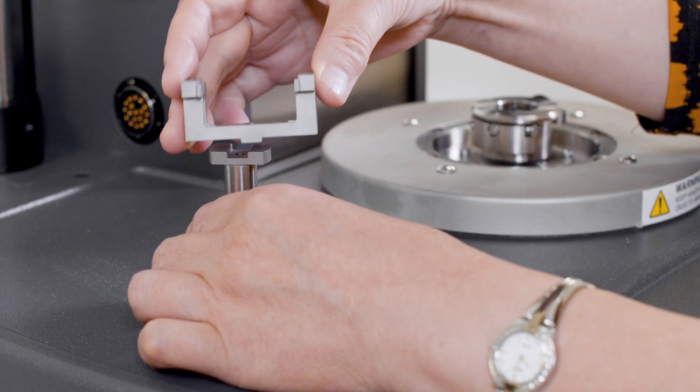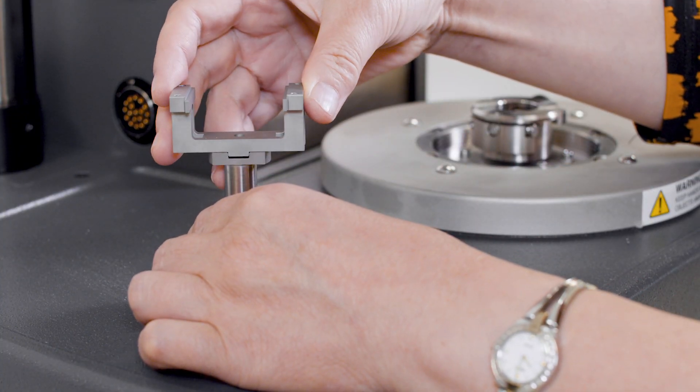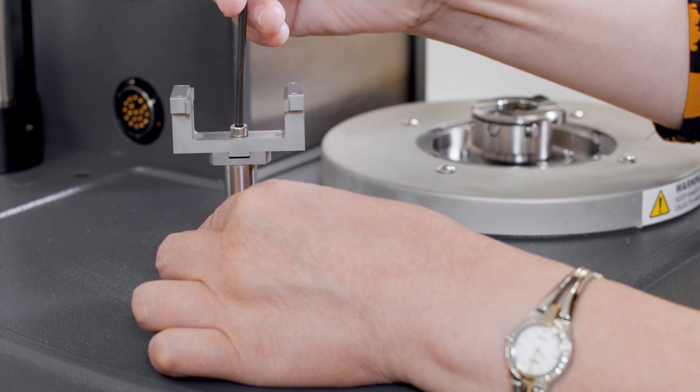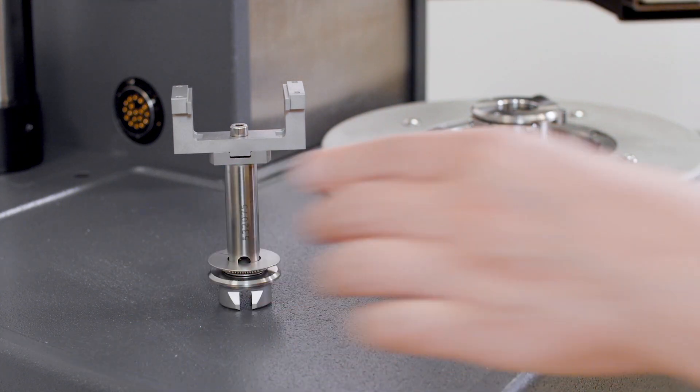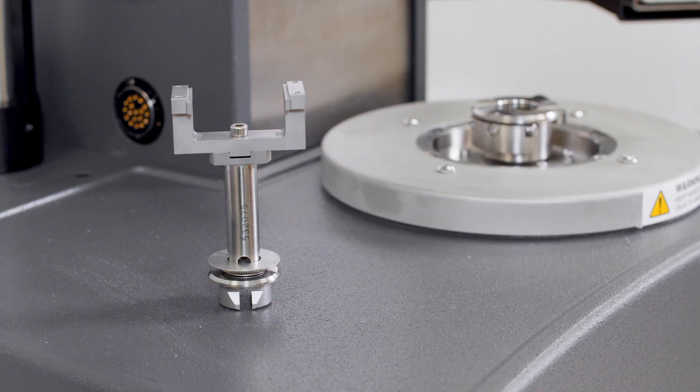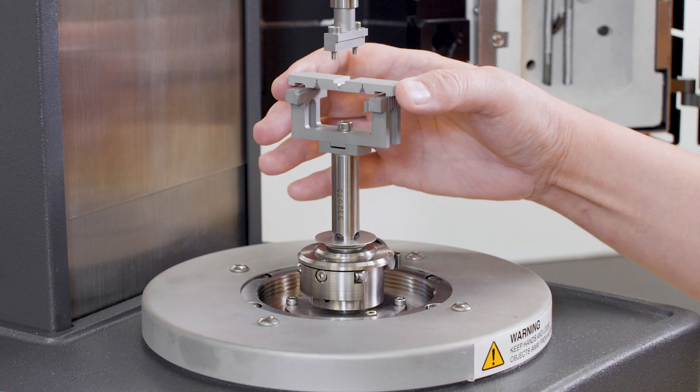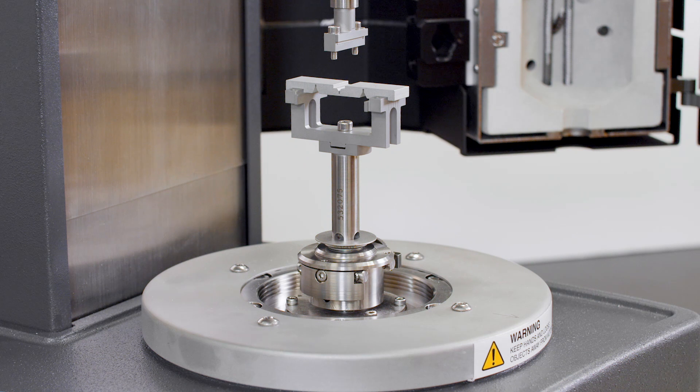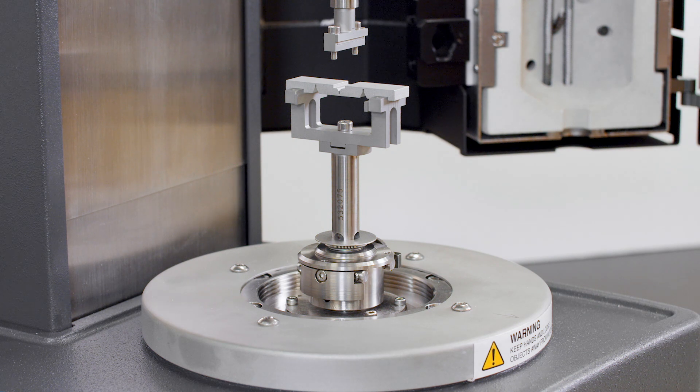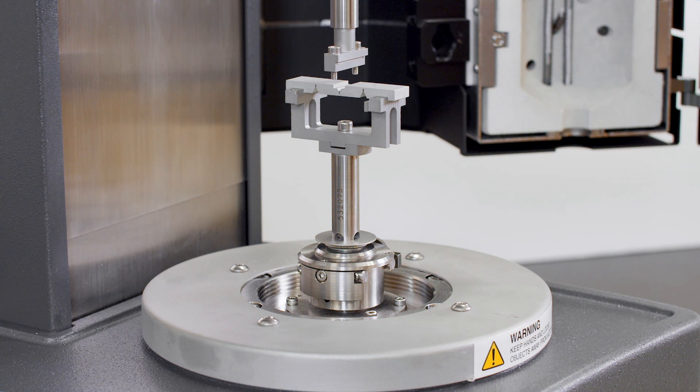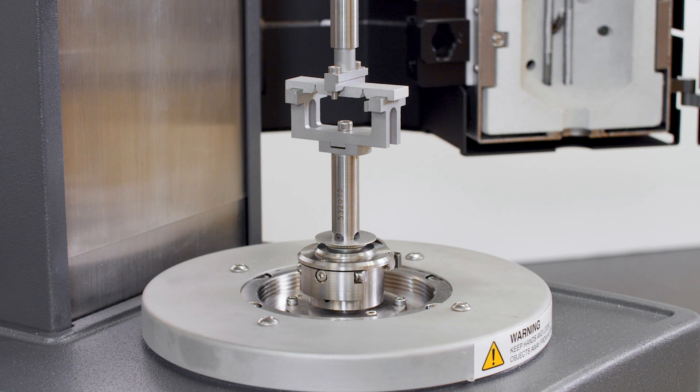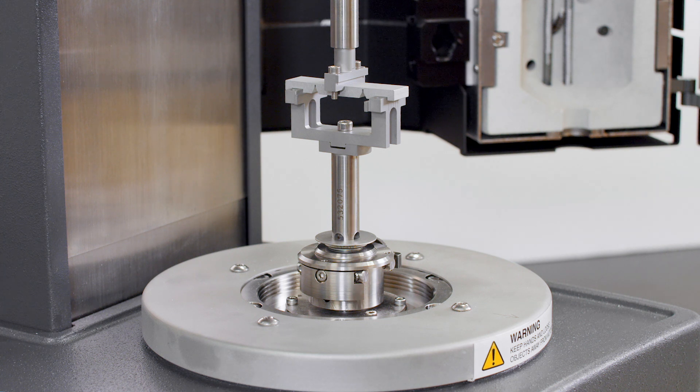Insert the 38mm size frame to the lower fixture. Mount the fixture to the bottom stage. Place the alignment tool onto the bottom clamp frame. Carefully lower the upper geometry until the upper tool is inserted into the center slot of the alignment tool.